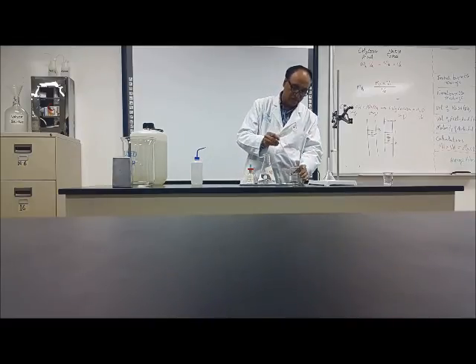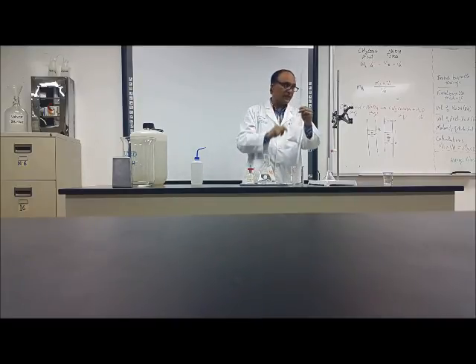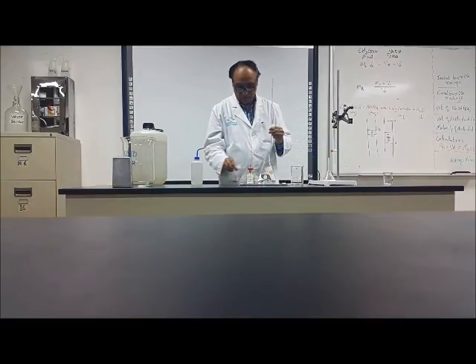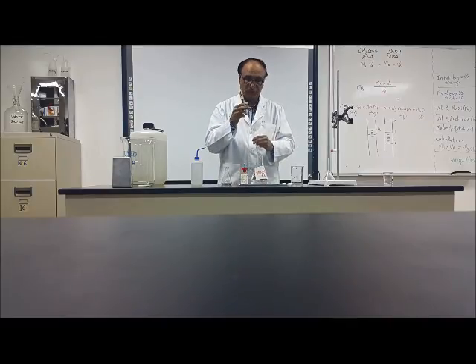When I wash with the distilled water, there are still some drops of water. And I want to remove them. So, I will take some part of this one.